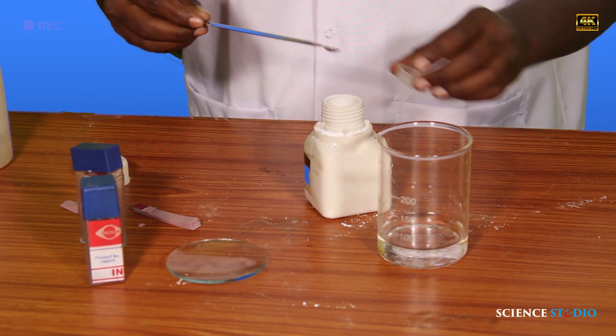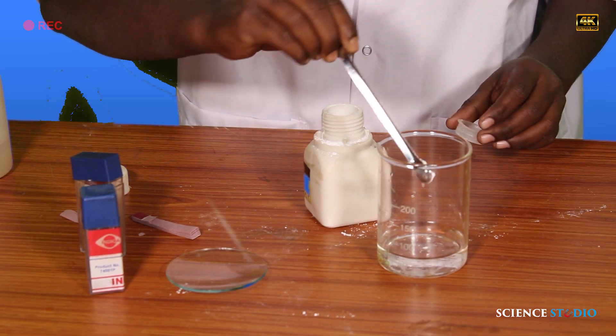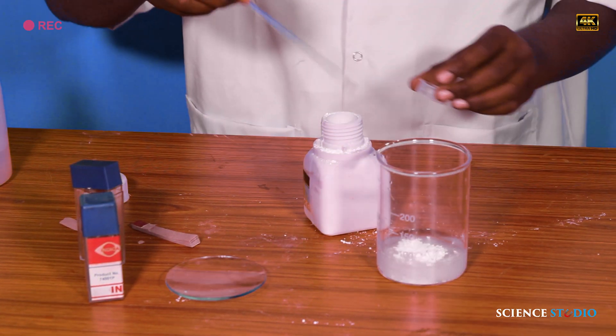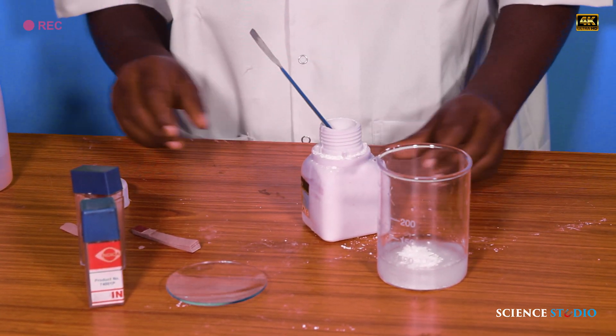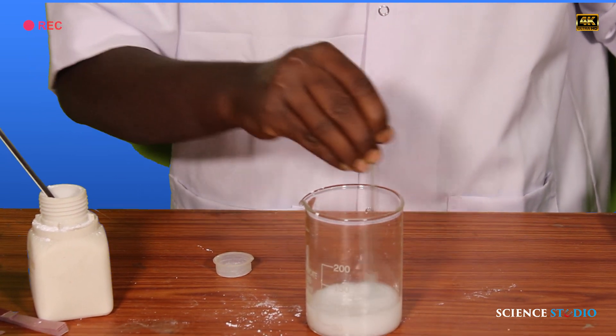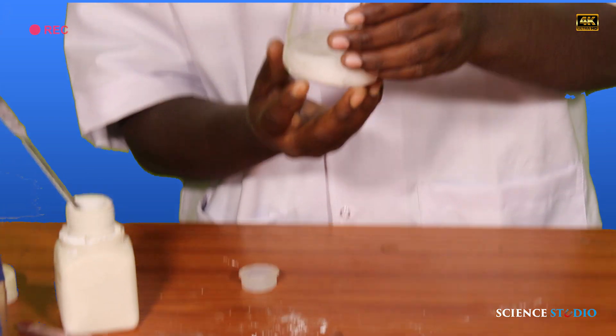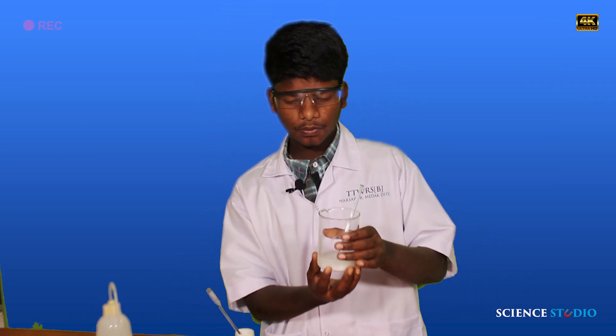Now we will perform the activity. Take 50 ml of water and pour it into the beaker. Add a small quantity of calcium oxide and stir it with a glass rod. Now touch the bottom of the beaker.